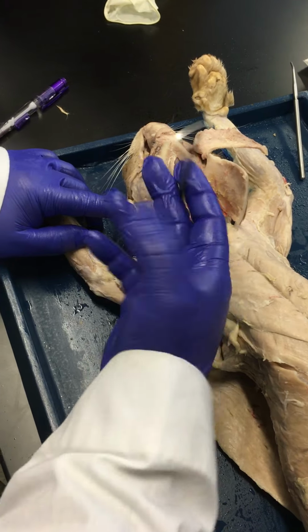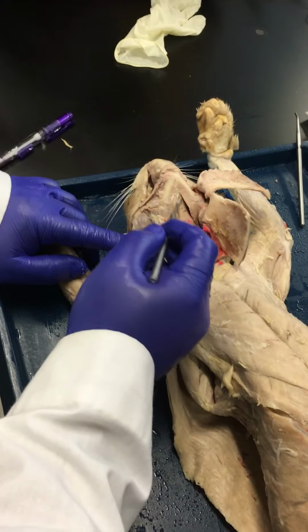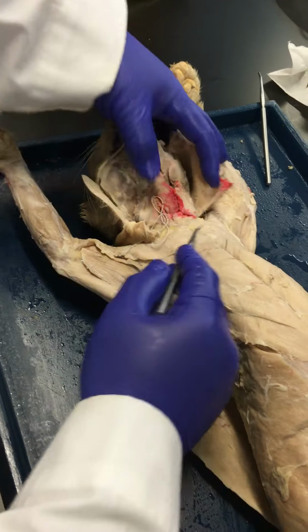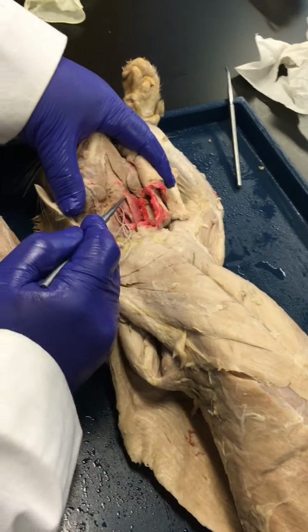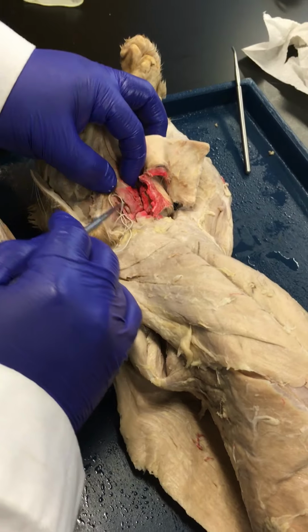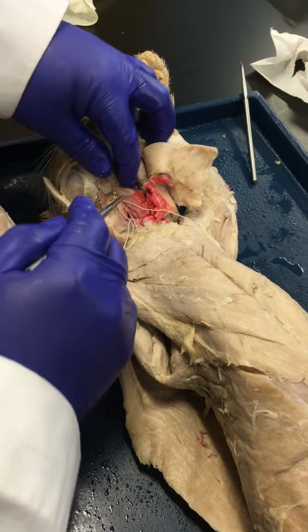In between the two digastrics, you have the mylohyoid. And so the mylohyoid makes up the floor of the mouth, and it's also going to elevate the floor of that mouth. Making our way down from there, you see the sternohyoids. And so there's going to be these two band-like muscles that are overlying the trachea or the windpipe here. These superficial muscles here. These guys then are going to depress that hyoid bone.